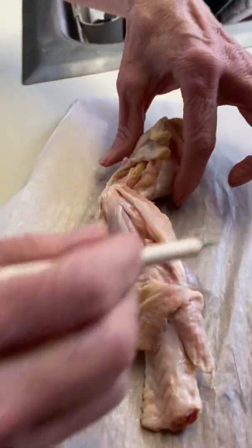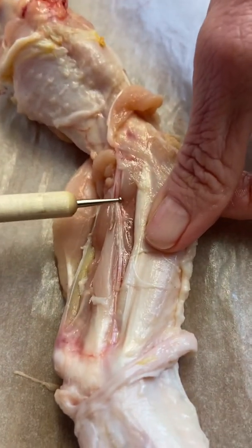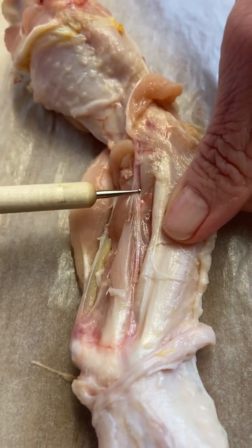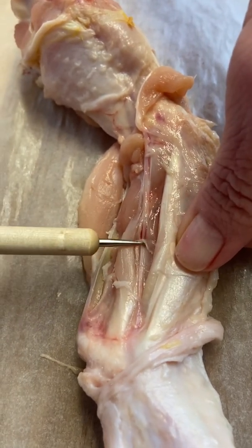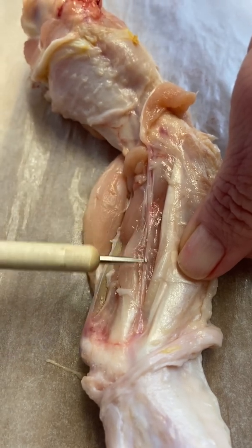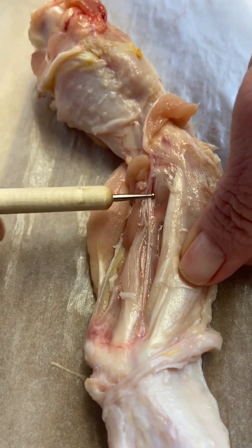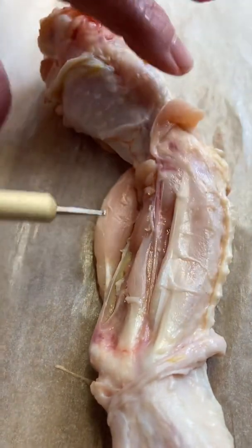And as far as blood, I had some blood vessels here. You can see that as I depress on that with my probe here, so you'll see the blood flow. You can actually see it right there, blood tracking through the vessel there. I'll just move that up and down so that you get a good visual of that. So that is our blood vessel there, which is also part of the connective tissue.